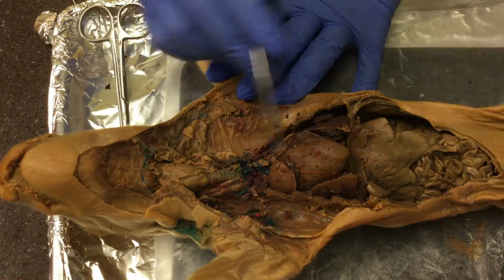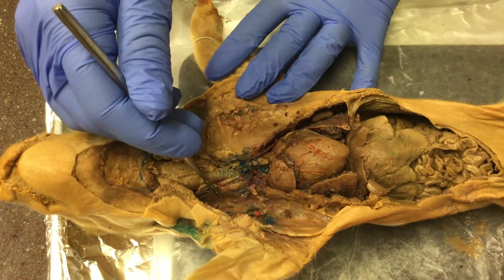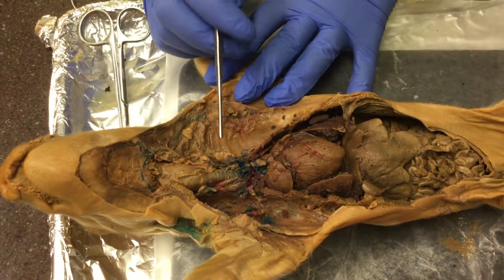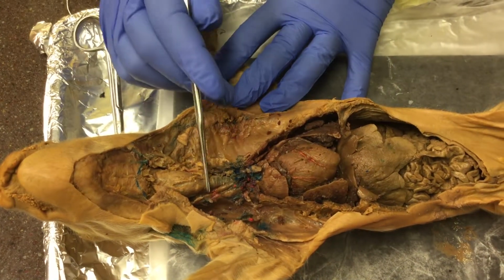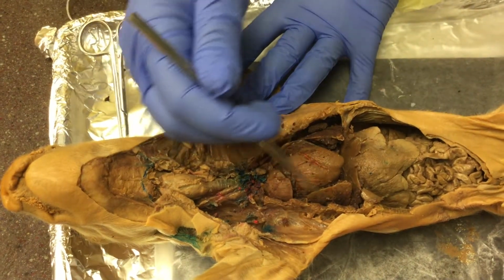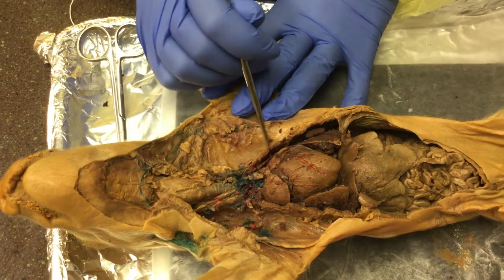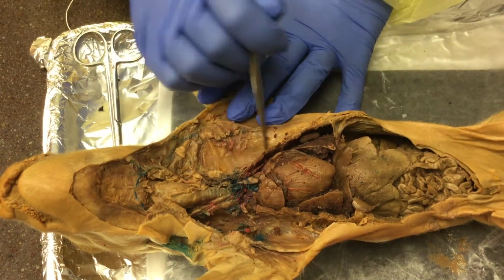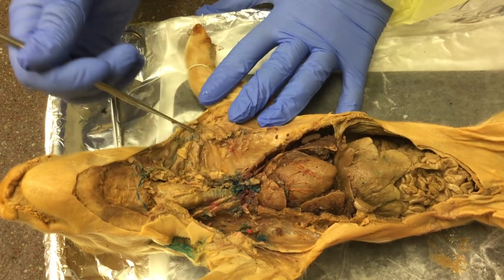You can see in this visual, the red structures are our arteries. The veins carry deoxygenated blood towards the heart. We've learned about the circulatory system with the heart and lungs and the exchange of carbon dioxide and oxygen in order to create the oxygenated blood throughout the heart.